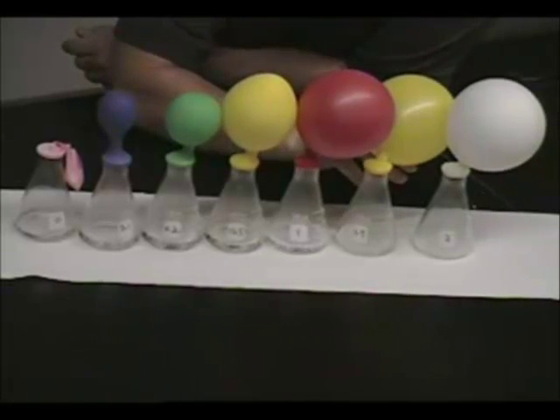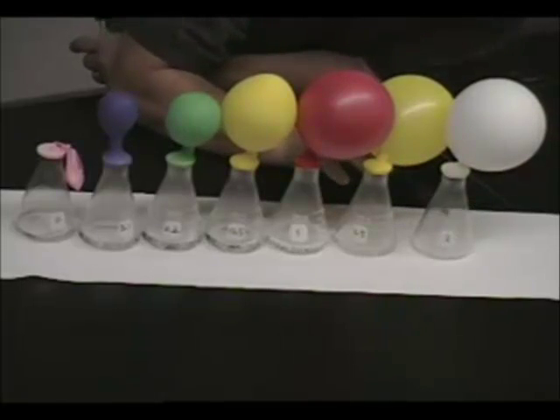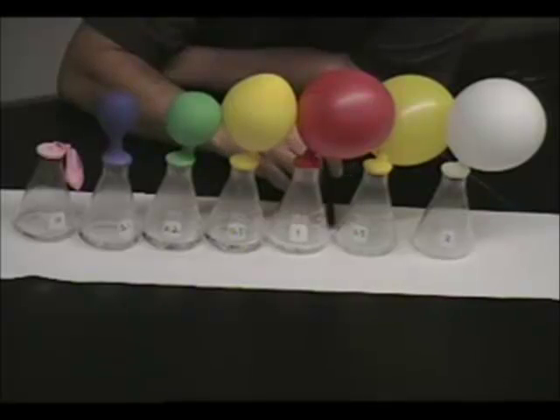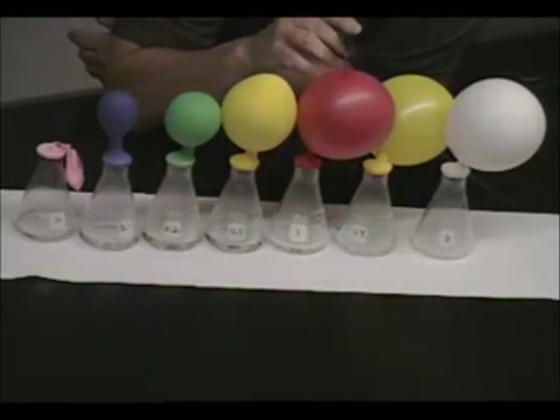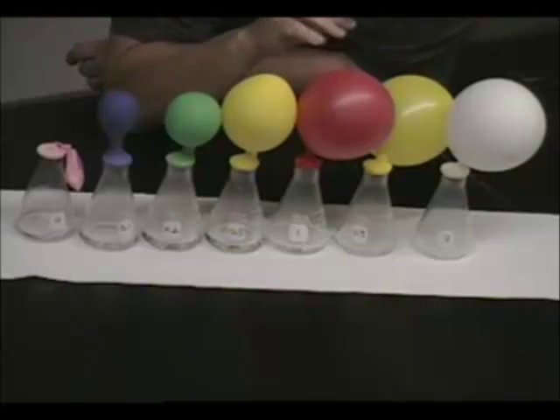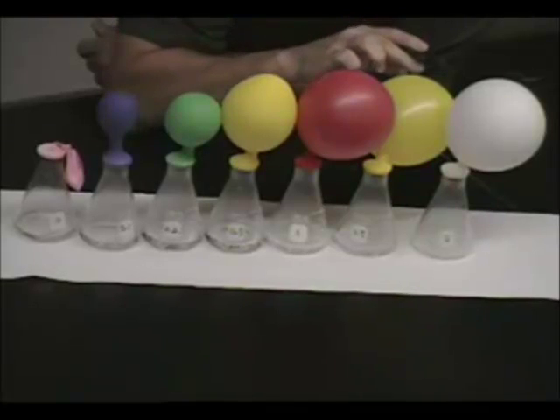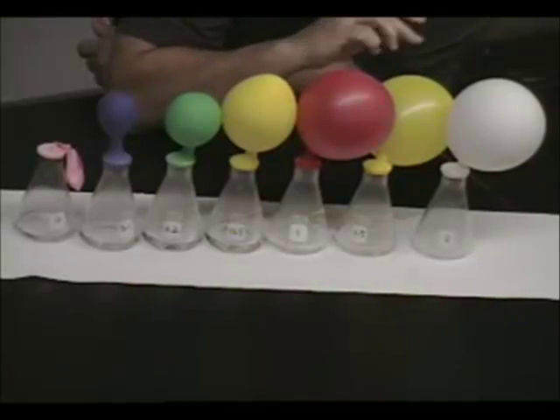Because we keep adding more and more magnesium. We got plenty of magnesium, don't we? In fact, I can see little flakes of magnesium down here in the flask that have not reacted. So, the acid, the hydrochloric acid is, and you can see it with your eye, right? Is the limiting reactant, isn't it? Because we have used up all of the hydrochloric acid in these three balloons, and we can't get any more hydrogen gas.